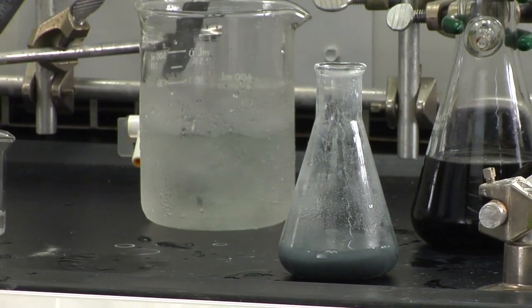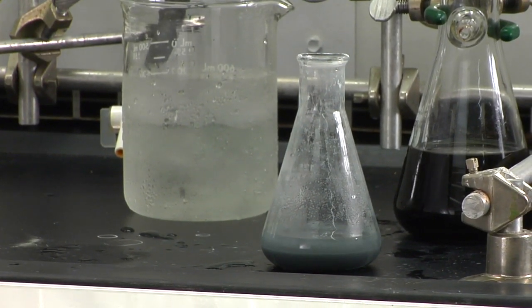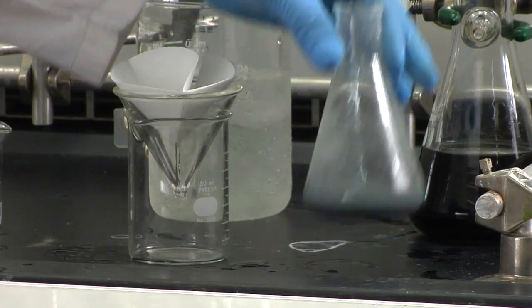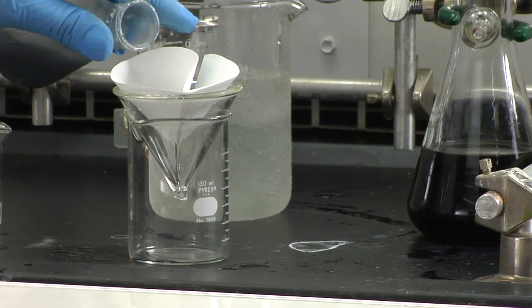To remove this salt, we're then going to filter by gravity. So you're going to set up your funnel and filter paper and filter it.